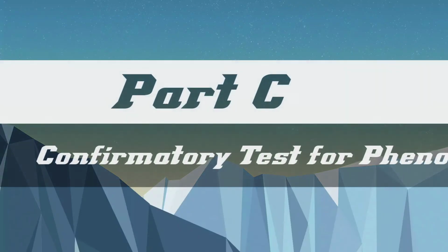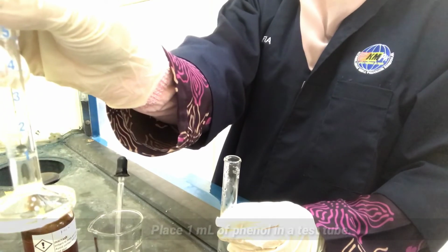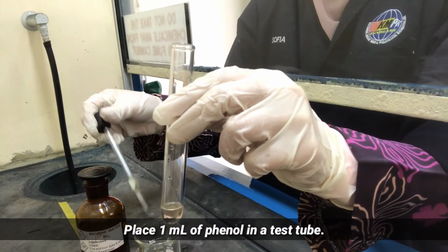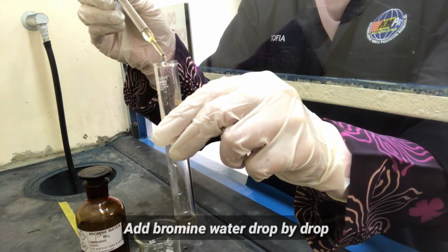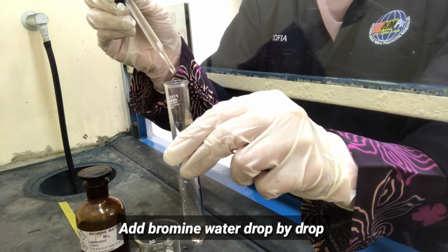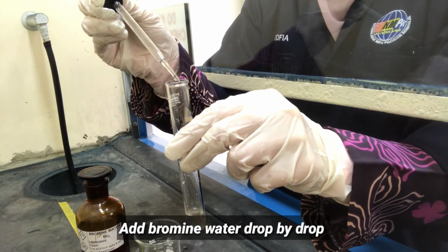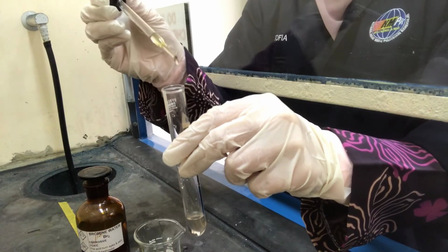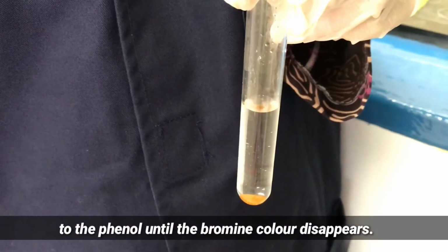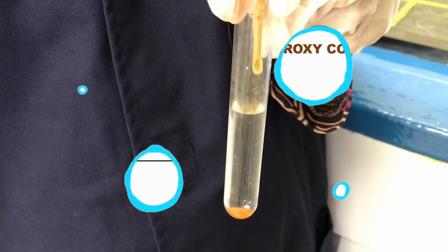Part C. Confirmatory test for phenol. Place 1 ml of phenol in a test tube. Add bromine water drop by drop until the bromine color disappears. And record the observation.